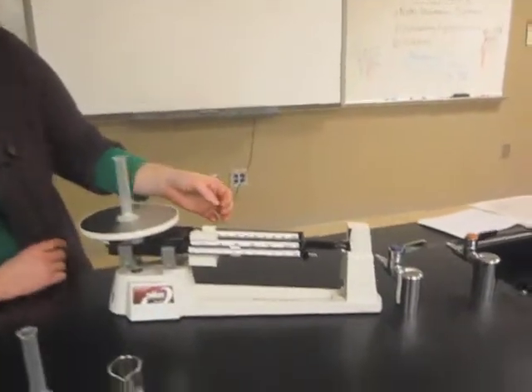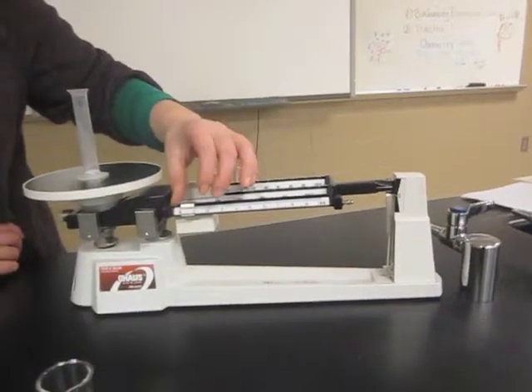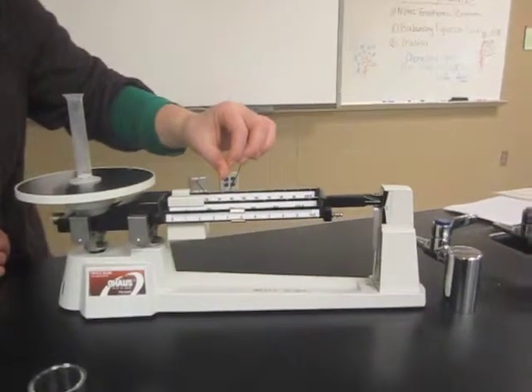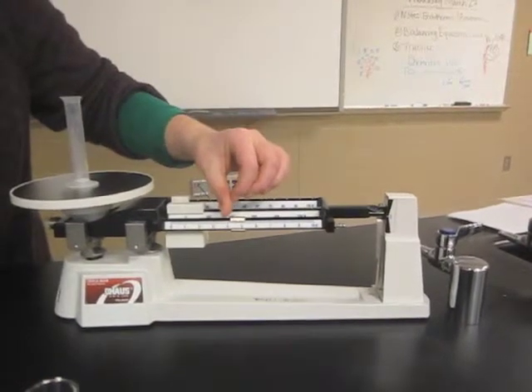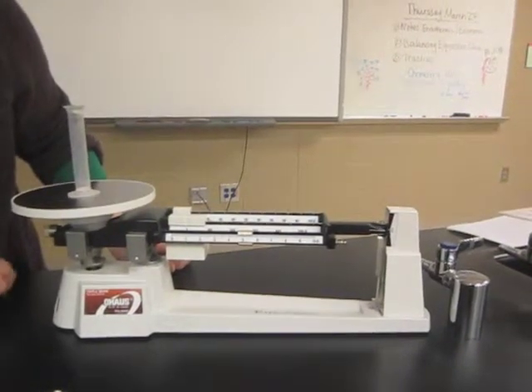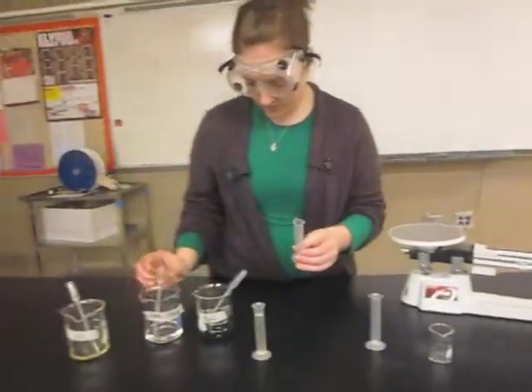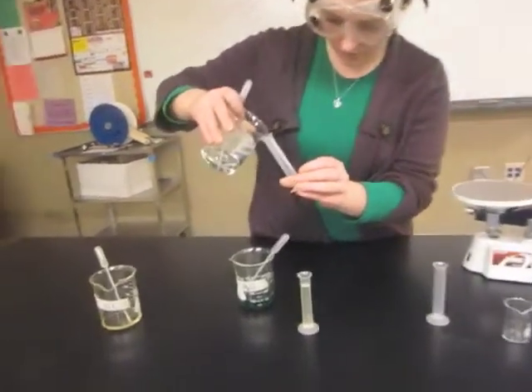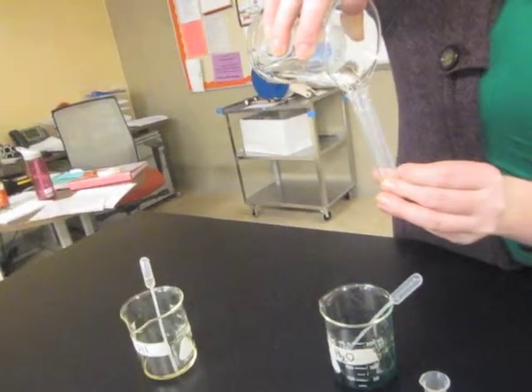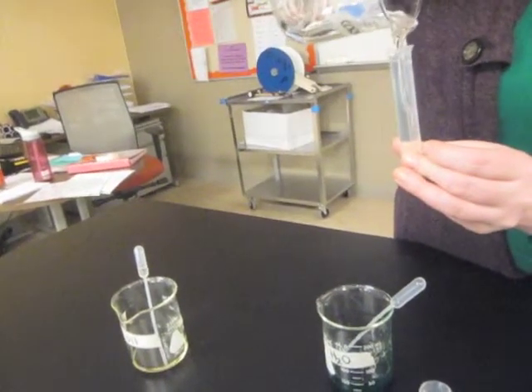Find the mass of the empty graduated cylinder and reset the balance to zero. The empty graduated cylinder for corn syrup will be about 5.3 grams. Fill it with 10 milliliters of corn syrup. It is very thick, so you're going to have to pour slowly.